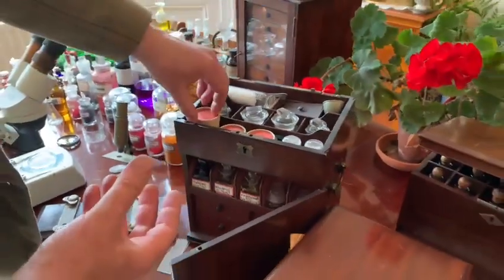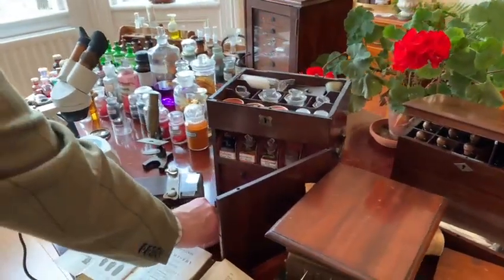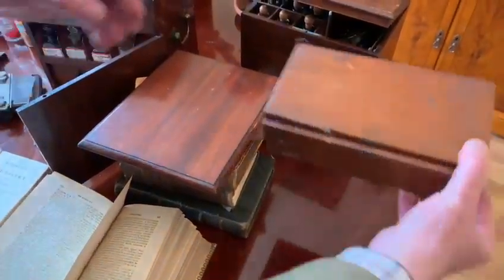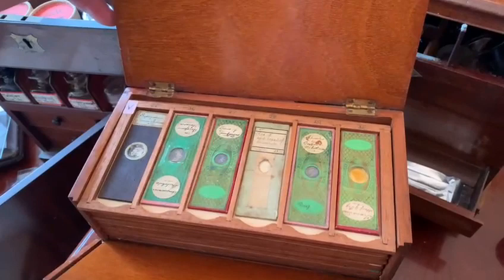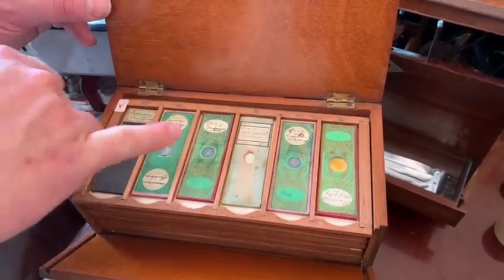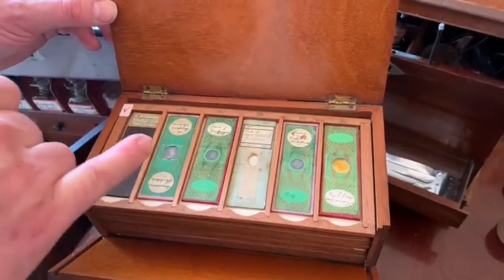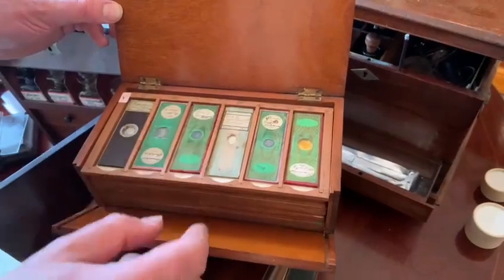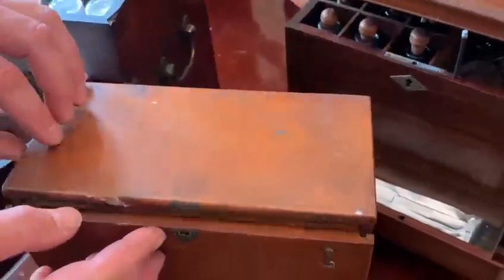Those would be resins used on a microscope slide. Here I have a little collection of Victorian slides — companies would have made these up from ferns and put in little specimens such as the spores from ferns, so that enthusiasts could look at them under the microscope. Some of these are labelled 1870, so they're very old indeed.